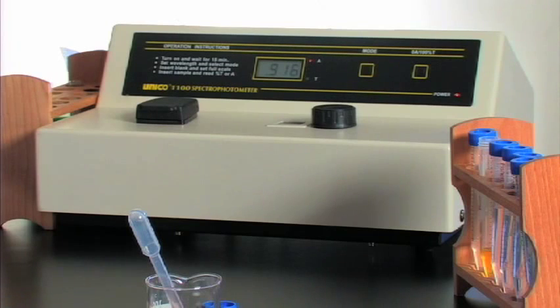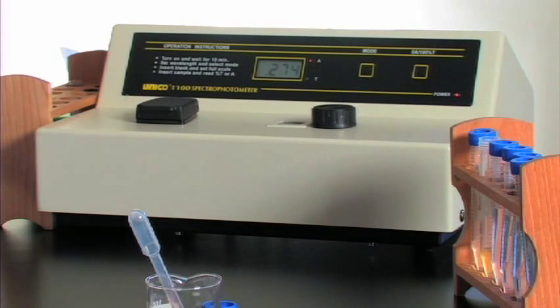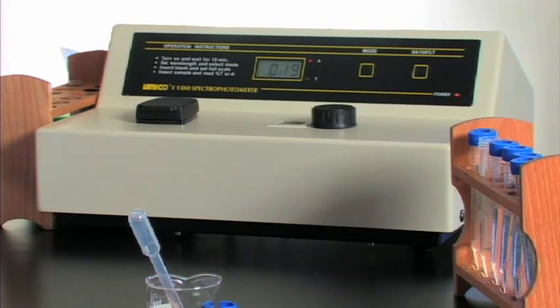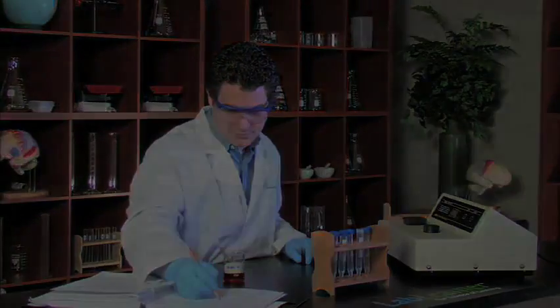We immediately see that the absorption's going down again. What's important for us in terms of measuring in this experiment is the actual time that it takes for the reading to come down to zero in absorbance, because that means that the iodine is gone at that point. We're interested in how the concentration of the reactants affects the speed at which a reaction takes place. Now that we're at zero the iodine's gone and he stops the clock.